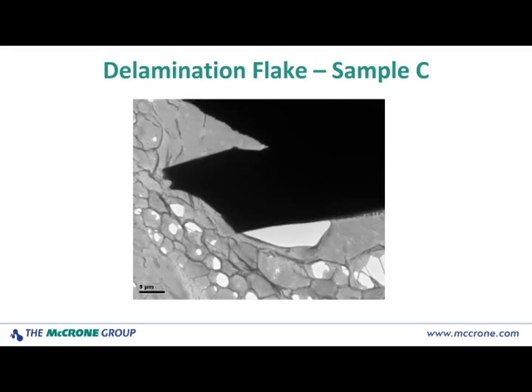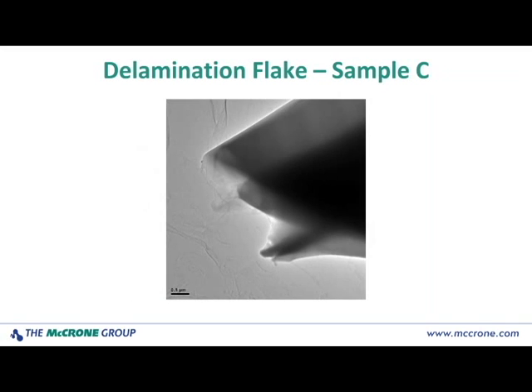In the case of sample C, and in this case delamination was seen in both the SEM and the TEM, an extremely large flake was overhanging the edge of the grid bar, and you see the carbon film has been kind of disrupted underneath it. As we go up in magnification, even though that delamination flake looked very large and quite thick, there are still thin edges at the areas that are very amenable to TEM analysis.